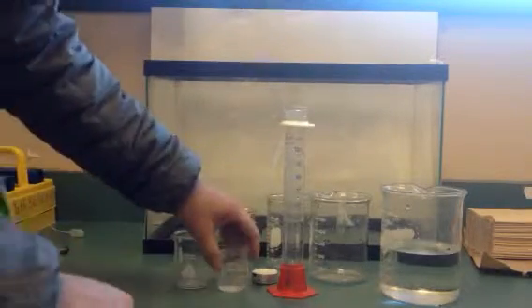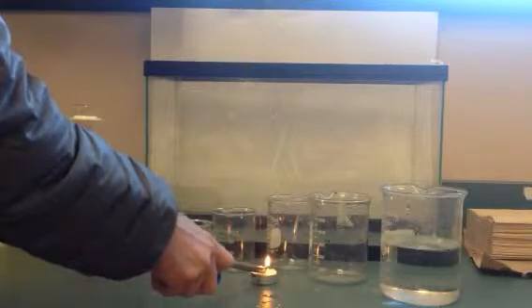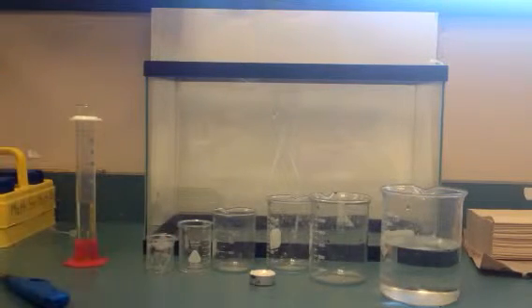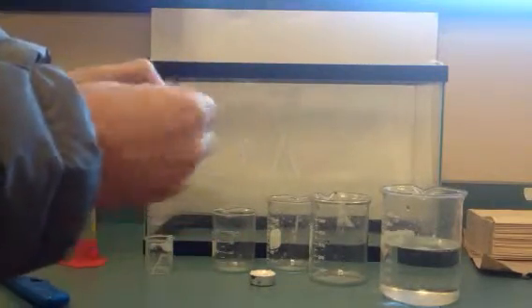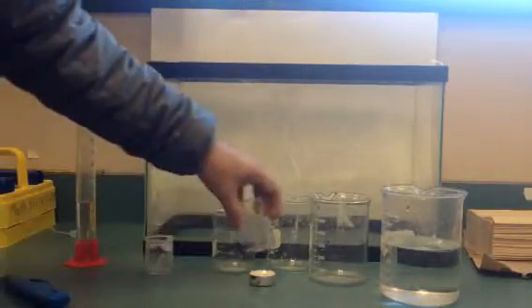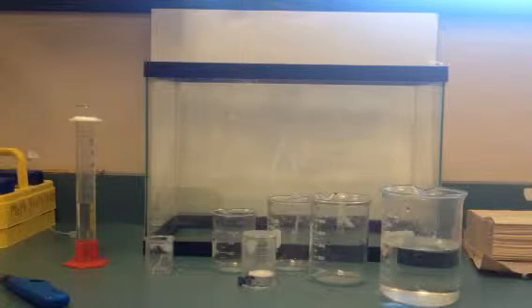Okay, so now we have the real volumes, and then the next thing we did is we burned the candle in each one of these containers. So we would light the candle, and we would burn in each beaker. Now, a lot of the beakers they have a lip on them, and so air can get in there. So what students did is they used a little clay to seal that air up, start a stopwatch, put it over the candle, and measure how long it took for the candle to go out.